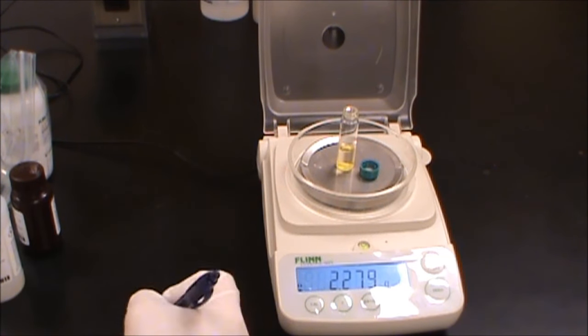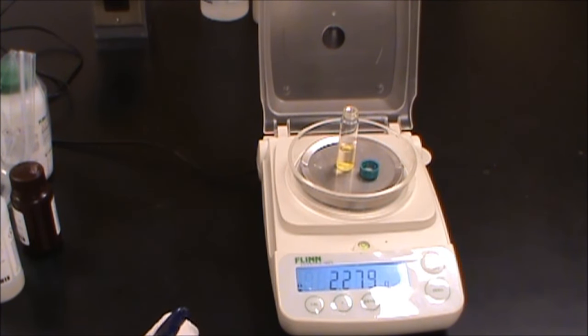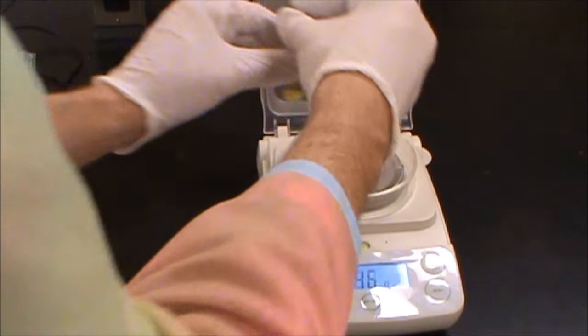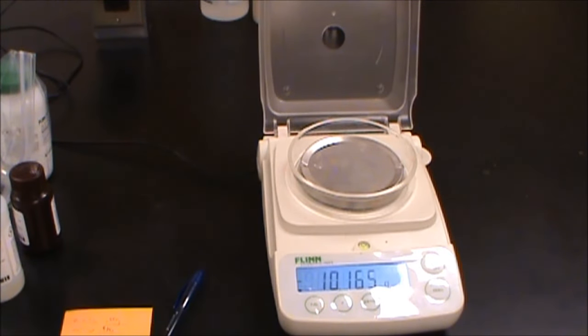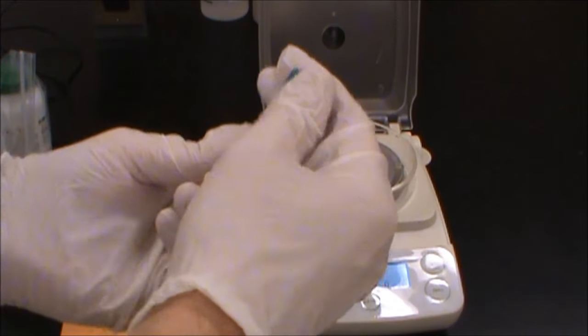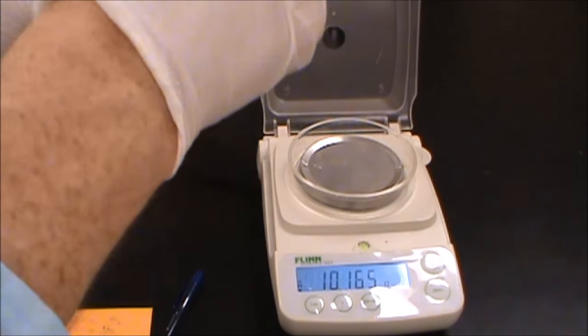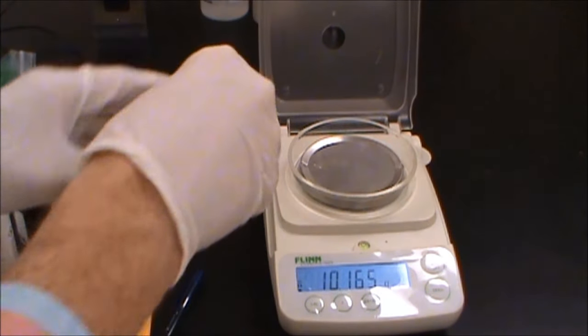2.279 grams of acetone. So now we want to take this and we want to give this a shake. We want to get this to dissolve. Always make sure that your cap is on there securely as best you can. It's not as simple as you might hope. There we go. We're pretty good in solution.